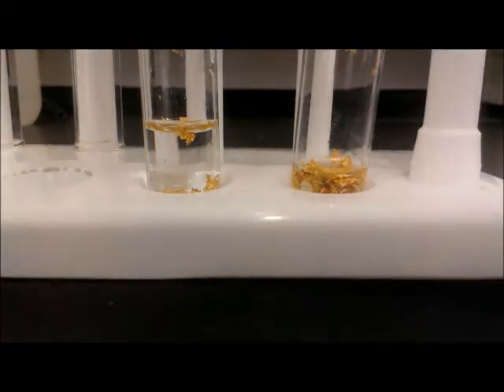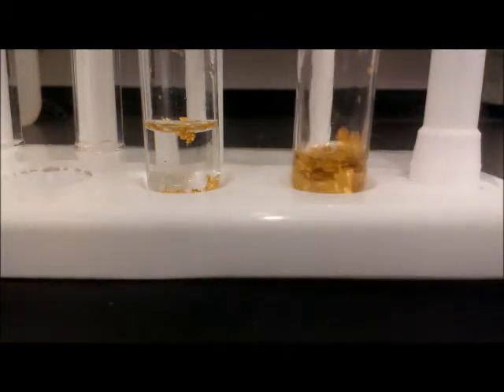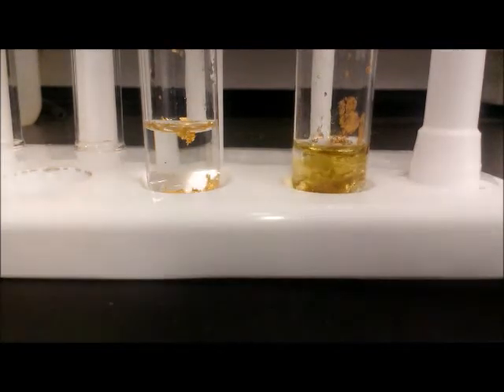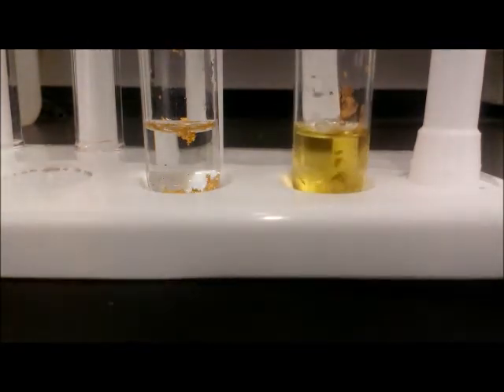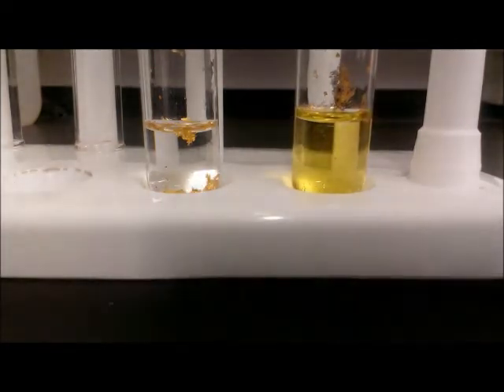As the acids mix, you will see a yellow color begin to appear. This color comes both from reactions occurring within the mixture and the gold three ions in solution.